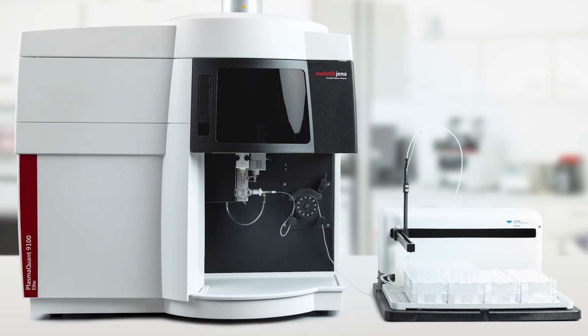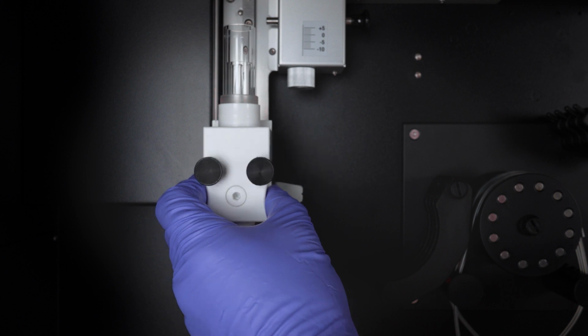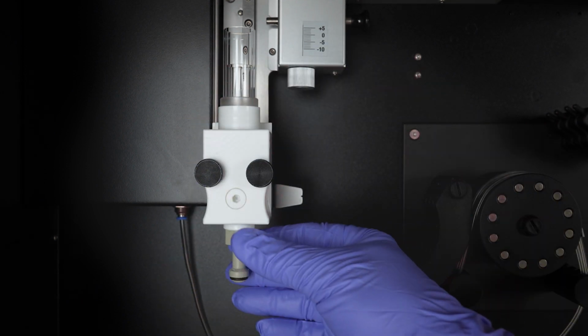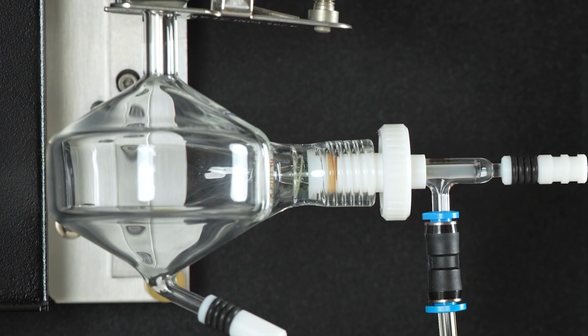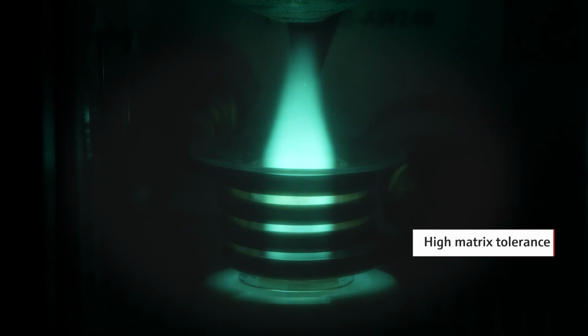The ICP-OES PlasmaQuant 9100 convinces as a waste analyzer with a high spectral resolution. The well-designed V-shuttle torch is easily accessible and features a long lifetime. It minimizes maintenance and reduces difficulties related to washout or sample deposition. Due to the robust plasma performance, even samples with high matrix loads can be reliably analyzed.